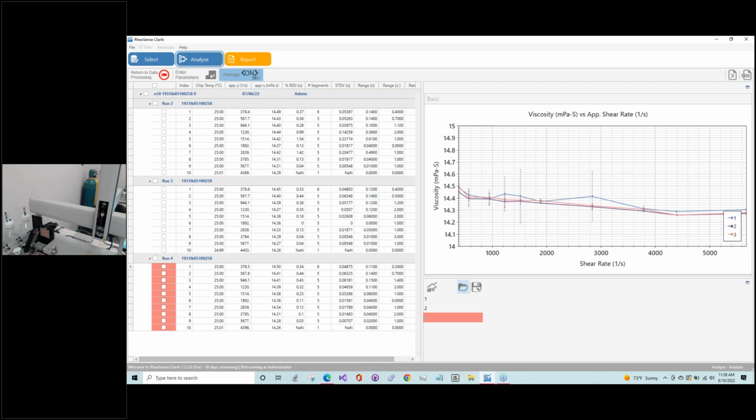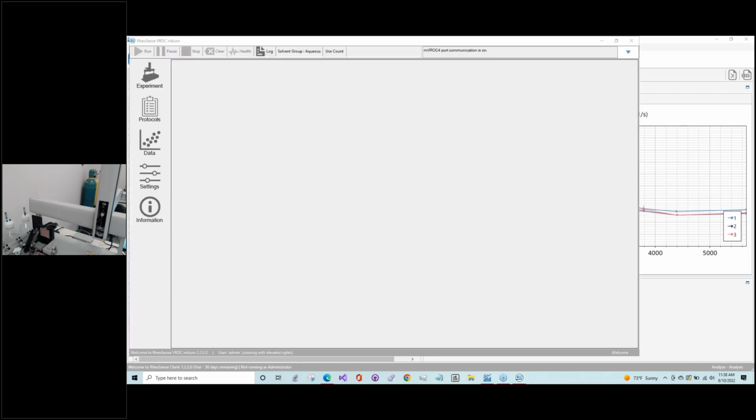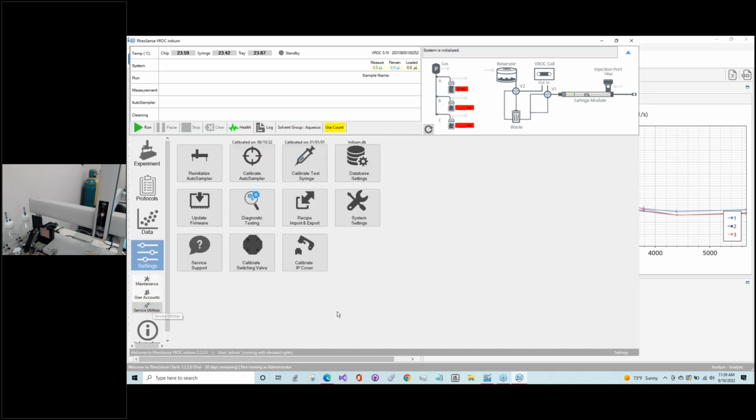So let's get back to, oops. This will also happen whenever you do any sort of calibration off that screen. It'll close the software and then reopen it, and it'll reinitialize the auto sampler. So let's go back then to the test syringe.